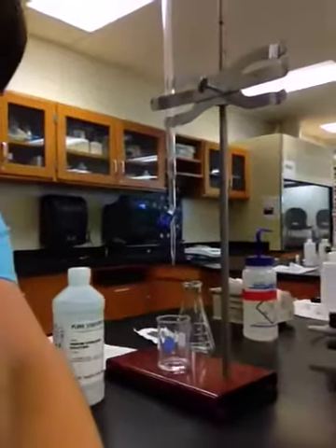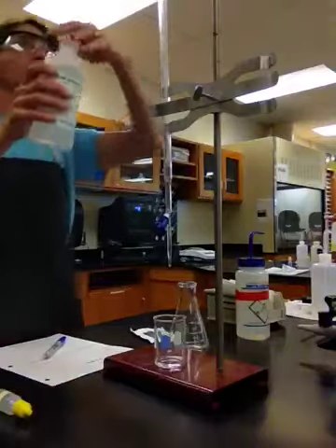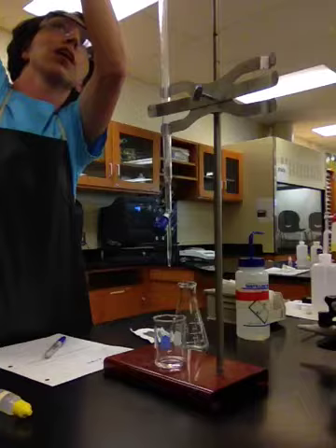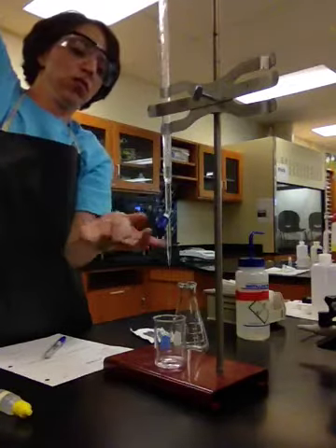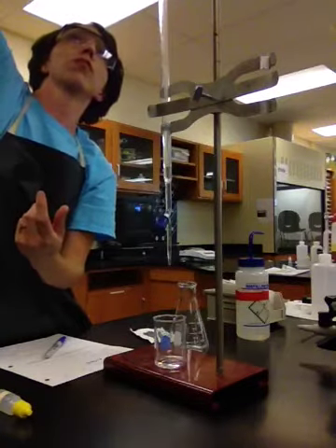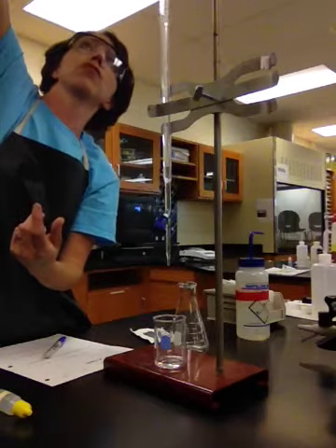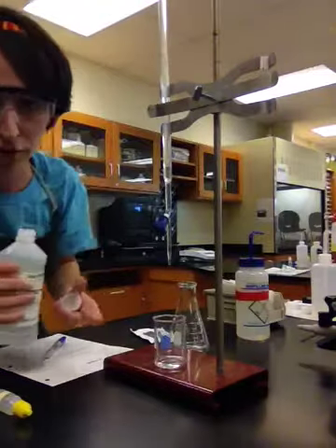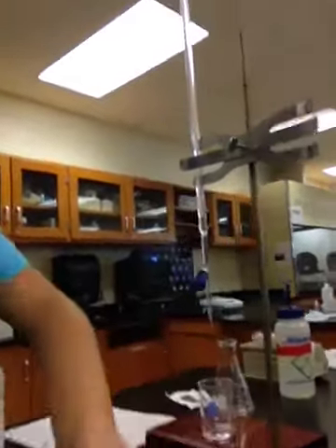Now, that's actually the second time I've done it, okay? So now I'm going to fill the whole burette up with sodium hydroxide. I know you guys can't see the top, and let me just tell you, if you are a tall person, uh-oh, I gotta close this. If you are a tall person, you were born to do titrations. I am not a tall person, so it's a bit of a struggle. Okay. Really don't have to fill it all the way to the top, okay? It doesn't really matter because I'm going to record wherever it started.